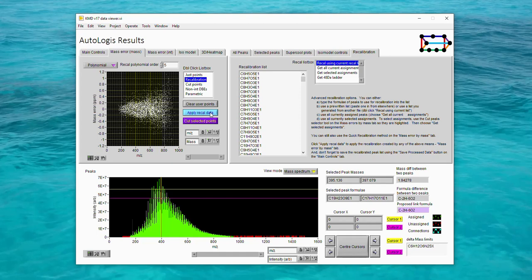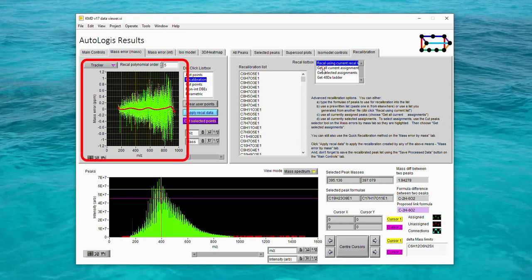However, AutoLogis offers two more advanced modes for those who need to use them. These modes are called Tracker and Walker, and are alternatives to a polynomial fit. You can access Tracker mode by changing the recalibration mode dropdown. Tracker mode is designed to correct for large-scale mass error trends in your dataset, and it does it by applying a long-range median filter to the mass errors, and then fitting a high-order polynomial to that filtered result. So having selected Tracker mode, we can get it to run by again importing all current assignments by clicking here. So Tracker mode has reviewed the assignments and has found some residual undulations in the mass calibration which it thinks could be corrected within the spectrum. And as with the polynomial correction, we can apply this recalibration by clicking the Apply Recal Data button.